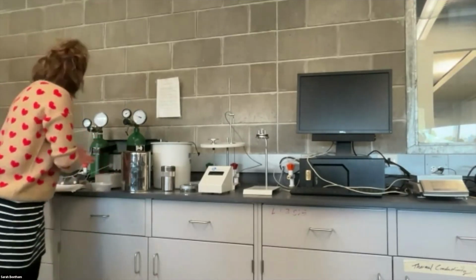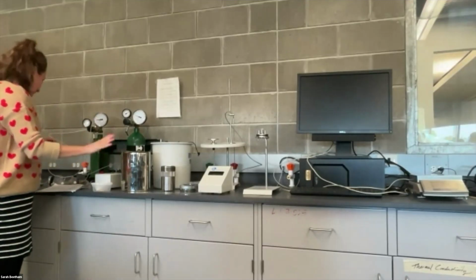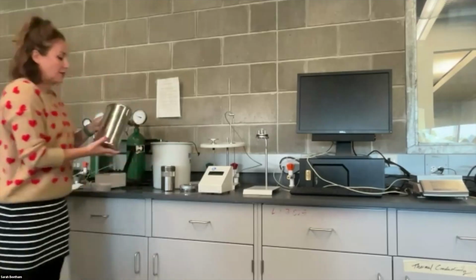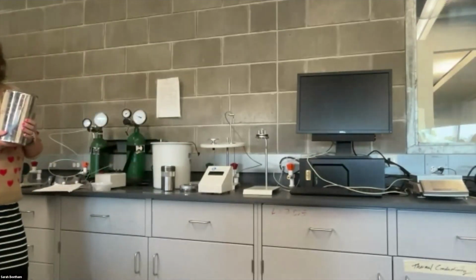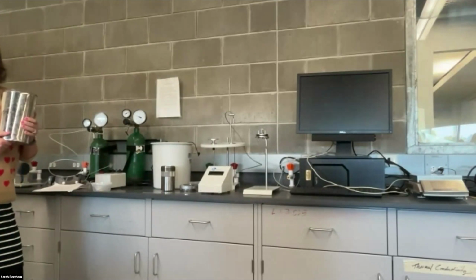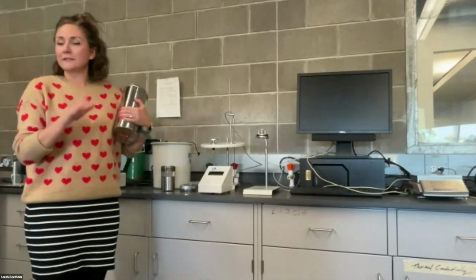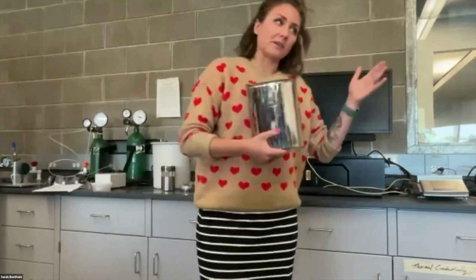Okay, so write down your food sample, write down which unit you're using. That's the first step. And then the second thing that you're going to do is you are going to take your water bath container, and you're going to fill it with 2 liters or 2,000 milliliters of DI water. So that's deionized water, essentially water that is completely pure. We're using an assumption that we're using pure water in our calculations, so we want to use that water for the experiment.